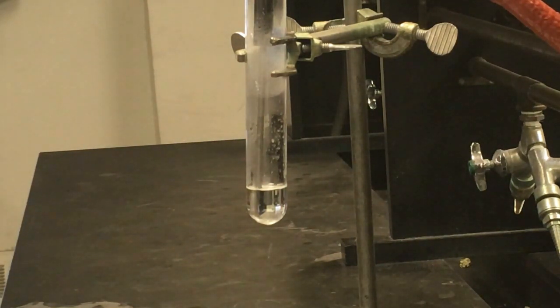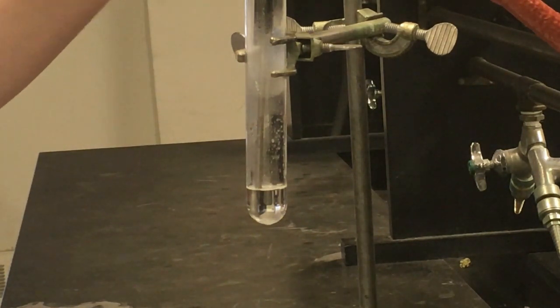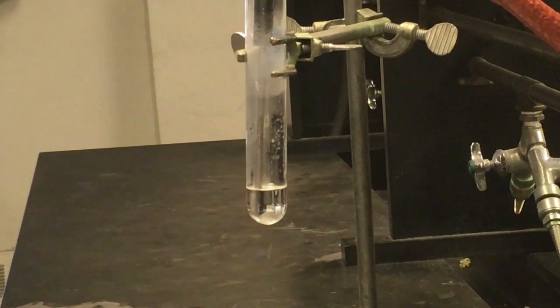So just keep an eye out to see when we get the first inklings of anything actually happening in terms of solids forming. I'm not going to stir the solution anymore or mess with it, because that can sometimes lead to weird blips in the data as your thermometer is recording everything on your LabQuest. I'm just going to wait and see when we get our first sign of crystals.